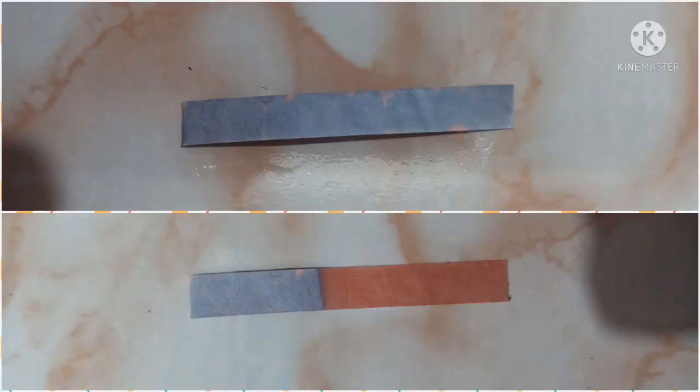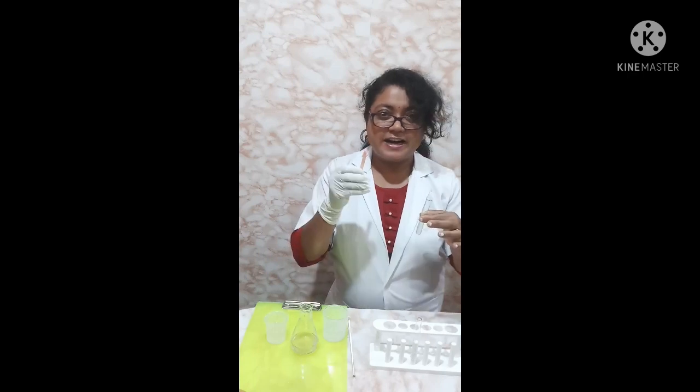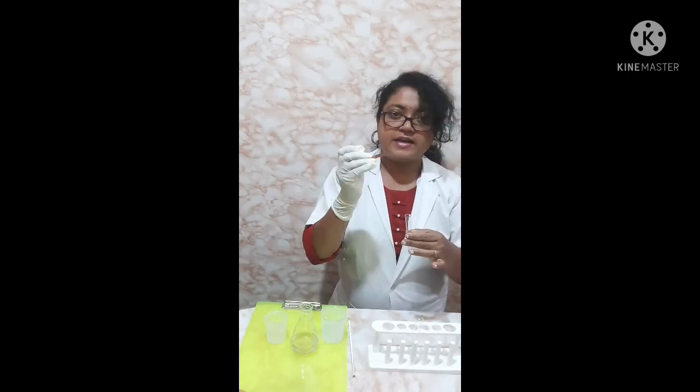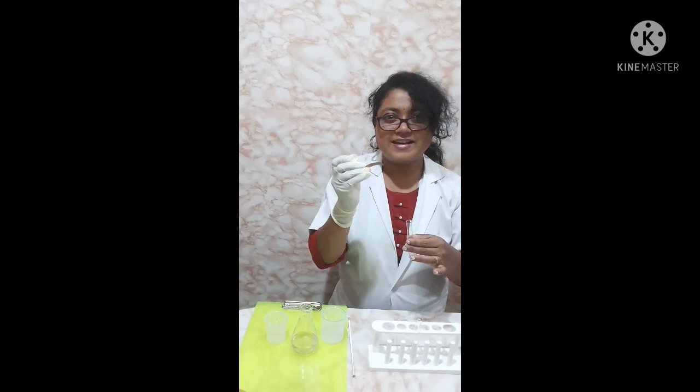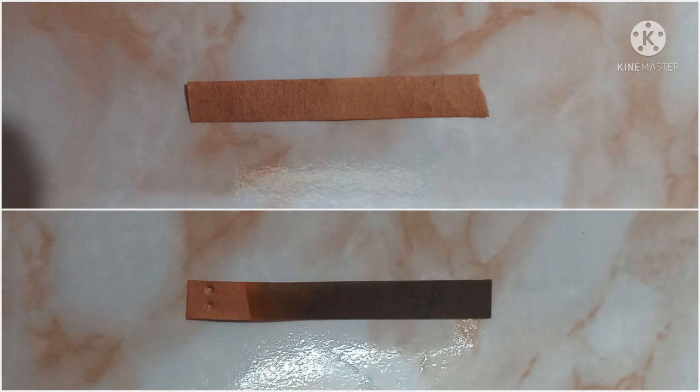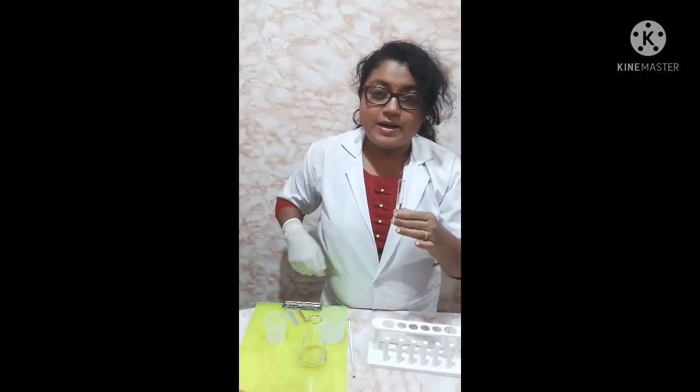We know acid changes blue litmus to red. Now let us test the soap solution. The soap solution changes red litmus into blue — here the color has changed to blue.